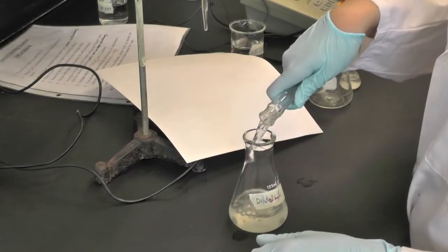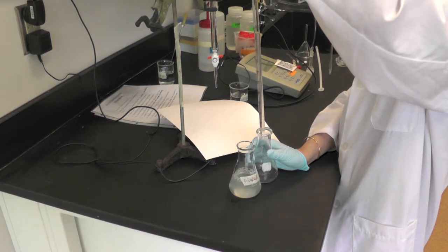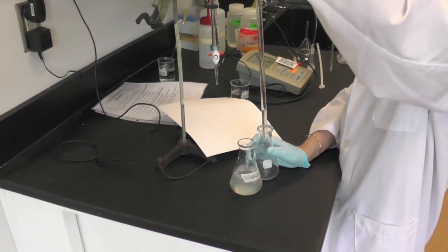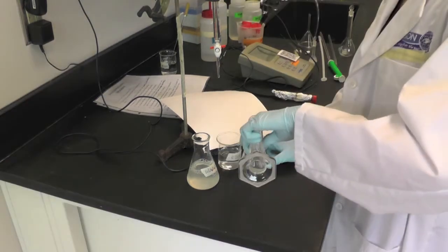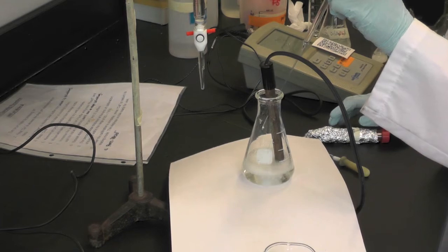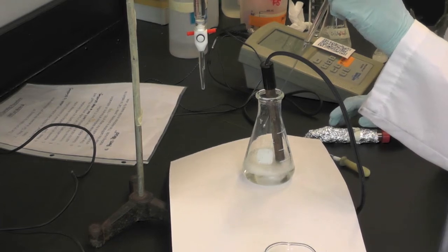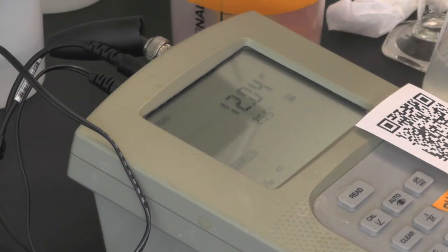To titrate the sample, start by pipetting 10 ml of the salicylic acid treated sample into a 125 ml Erlenmeyer flask. Then add 5.0 ml of EDTA and 15 ml of DD water to the flask. Stir and read the pH with the pH meter. Then add 2 N KOH solution drop by drop until the pH reaches 12 to 12.5.